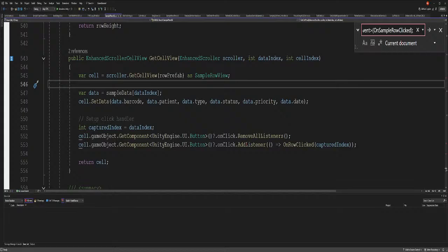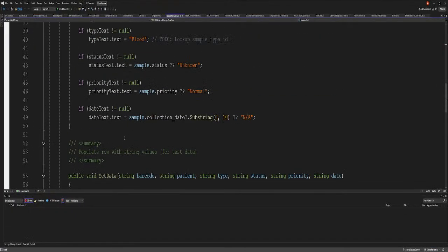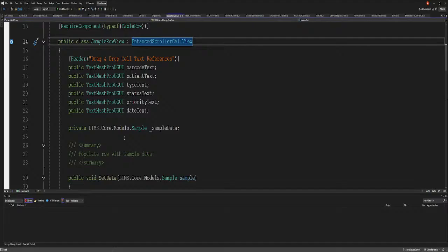So what we're gonna do is this. What was my prefab? Here goes my prefab. So what we're gonna do is drag and drop. Let me lower this so you guys can see. We could either add a sample row cell view method, so whoever clicks on us, we return the actual data. So let's just do that here. I like it here better because we don't have to make another script. You can if you want to.